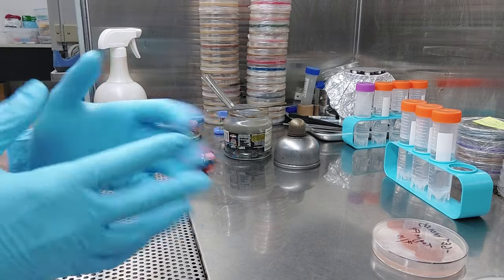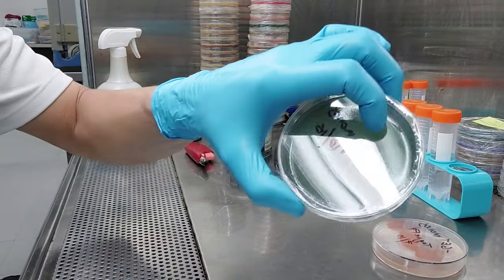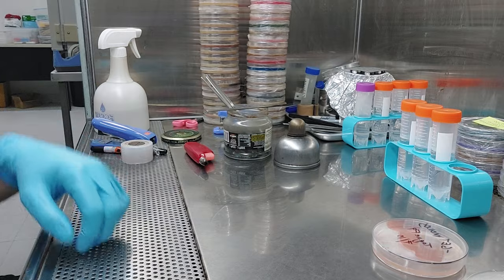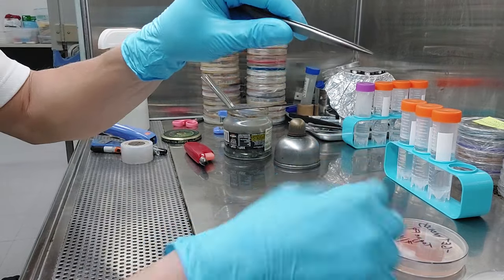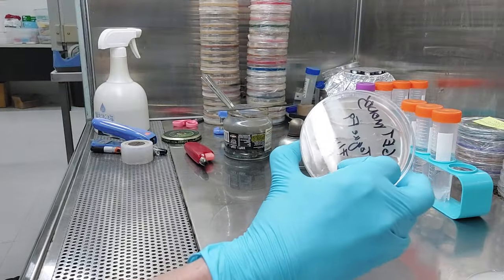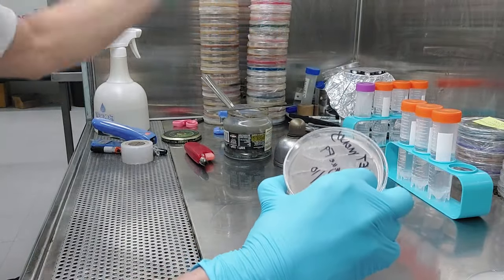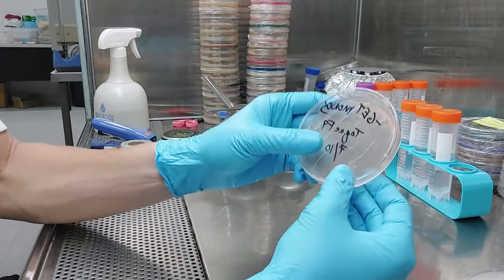I still have a bunch of toque swabs. If one of these eight isn't a mono, I'll just try it again. I'll do the same thing: grab-and-drag, take my swab, grab a little piece of cotton, drag it through there, release at the end.